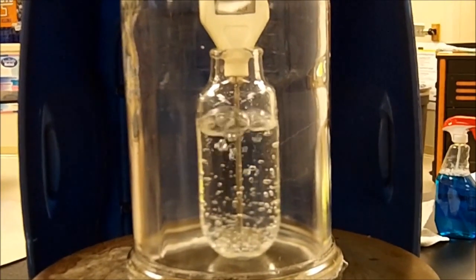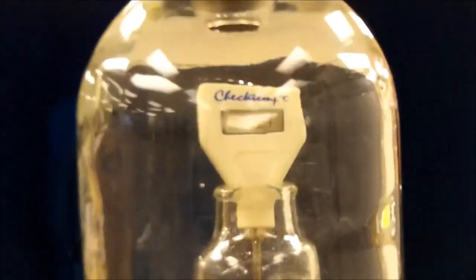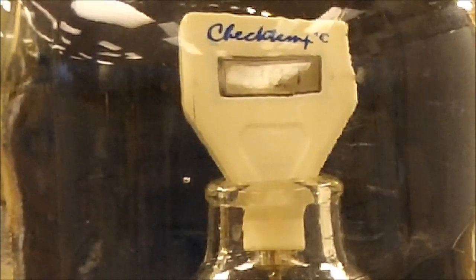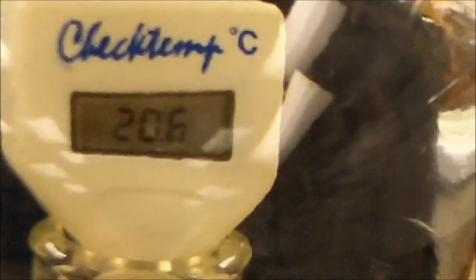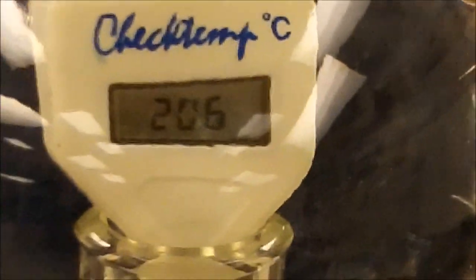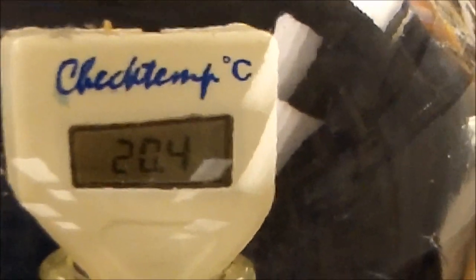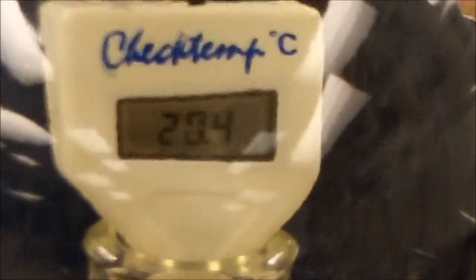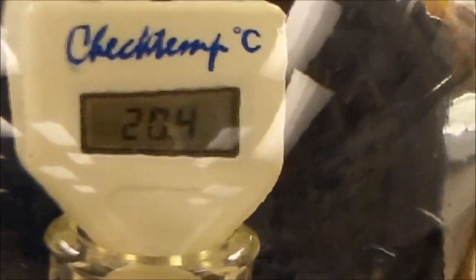Now, as this is still boiling, let me zoom in on the temperature here. Let's position it so we can actually see the temperature. And the temperature right now is at 20.6. And it was at 20.8 when we started. Now it's at 20.4.